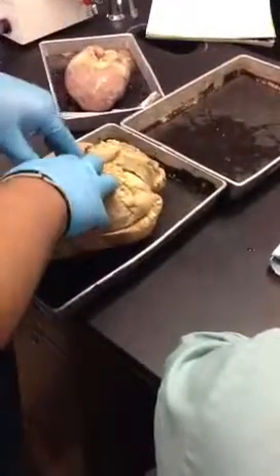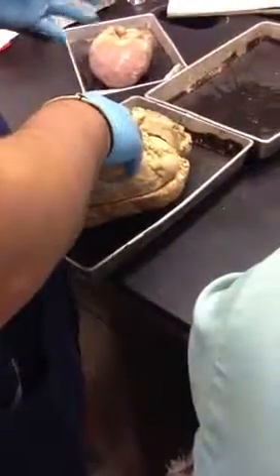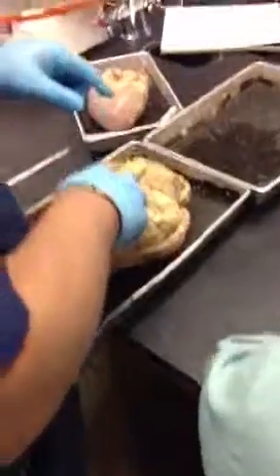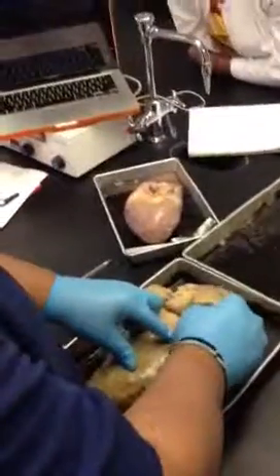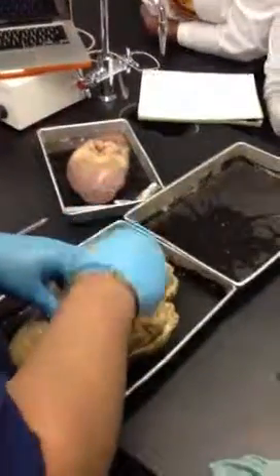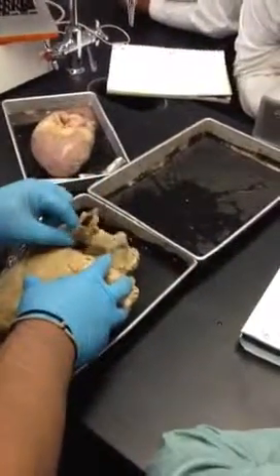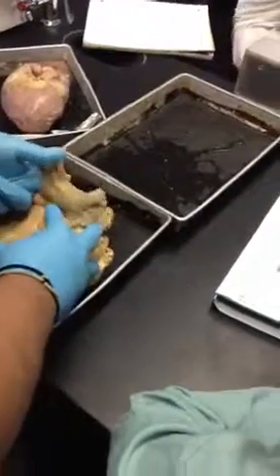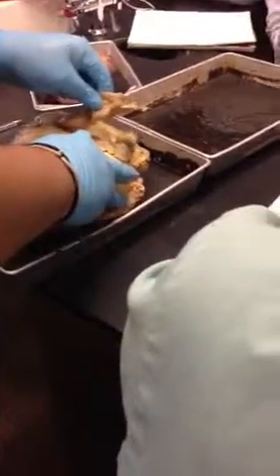we're now able to identify the structures that lead into the auricle. So the right atrium has blood coming into it from the superior and inferior vena cava. So we know that there should be a structure running into this that is carrying blood from the superior and inferior vena cava. So sure enough, we can see that there's a hole right here. This hole, I can follow it, and sure enough, my finger goes right inside, and I'm moving the atrium. That tells me that this has to be the vena cava.